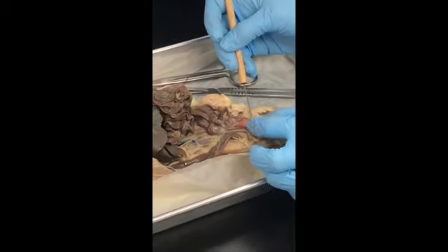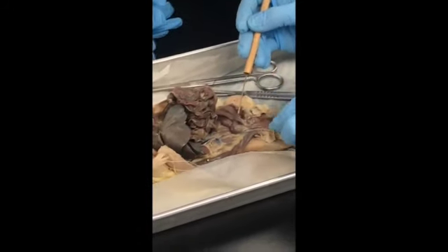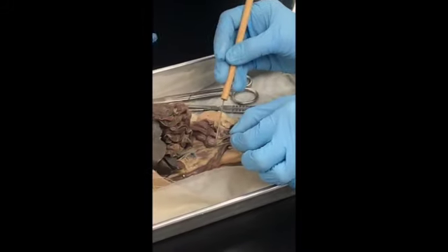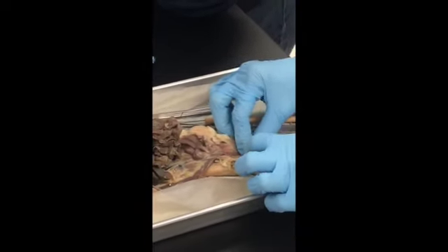So Yasser, do you see how I took it out, I cut the fat away? So this is the vas deferens, and you can see where it begins. So it's always nice to know the origin. Okay, so it starts here and then runs down and attaches to the testes, which are right here. Any questions? Cool things on this. I'll move my hand in a second.